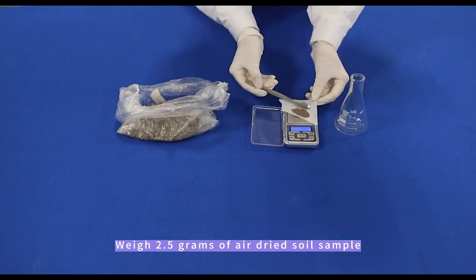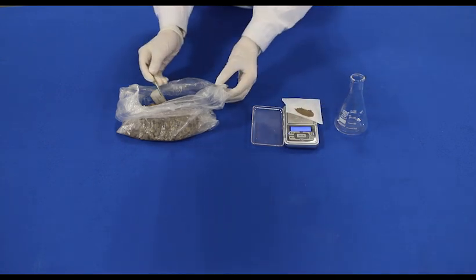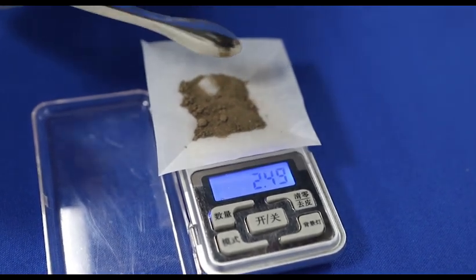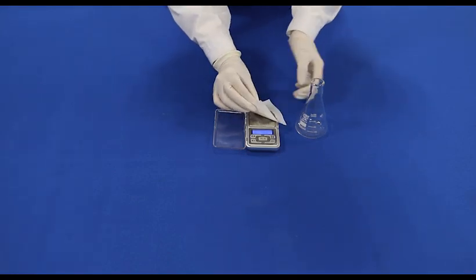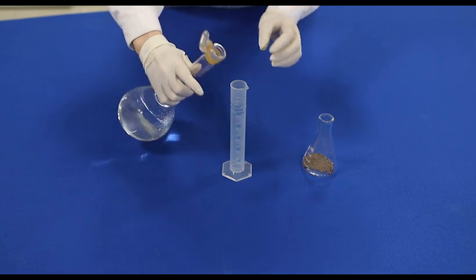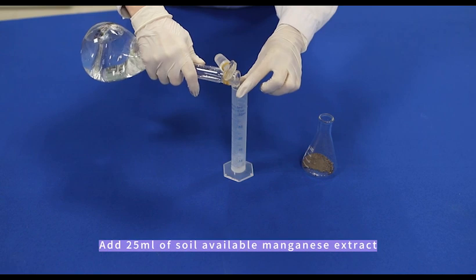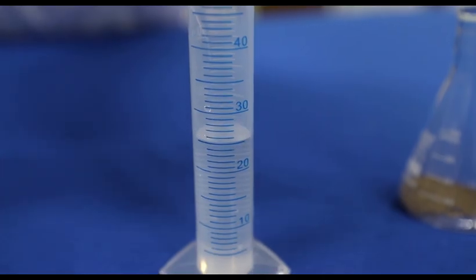Weigh 2.5g of air-dried soil sample and place it in a 100ml triangular flask. Add 25ml of soil available manganese extractant.